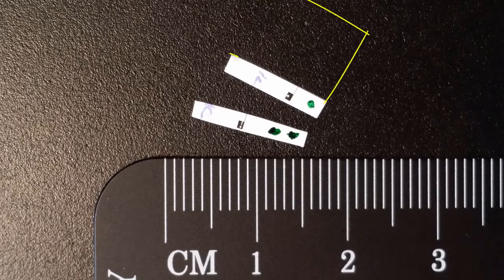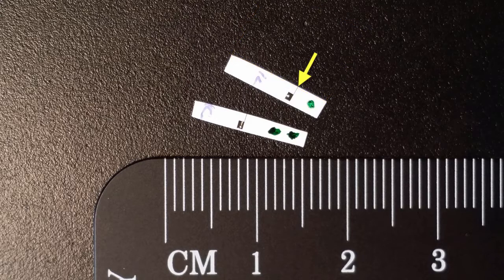Here in the picture you can see two pieces that have been cut in two. On top of the paper, a silver printing pattern has been printed. What we want to do is study the cross-section of this print.